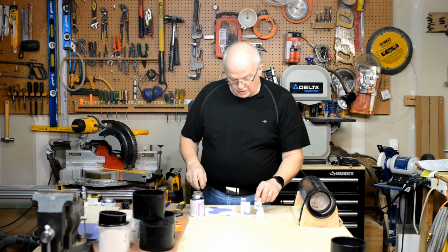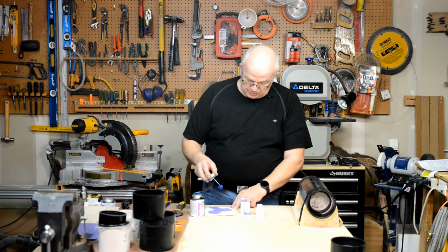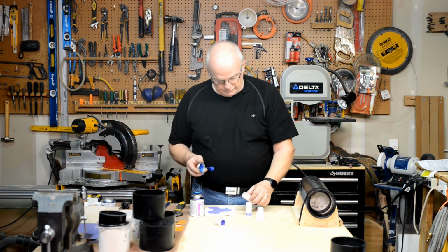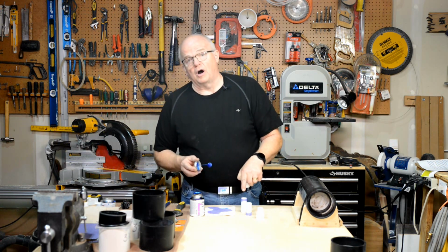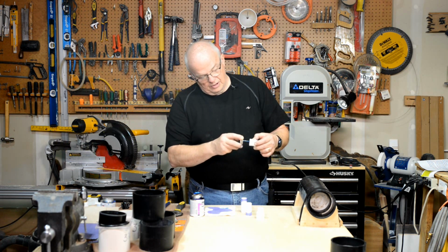Okay. Next thing you're going to want to do now is apply some adhesive cement. The same thing applies. Don't pull this out just dripping with cement. You're going to get it all over the place. Touch it against that paper. You're going to want to put the cement inside the adapter only. Do not put it on the PVC pipe. And be very careful not to get any on that outside edge. Put the cement all the way back down. Put a fairly liberal amount in there.